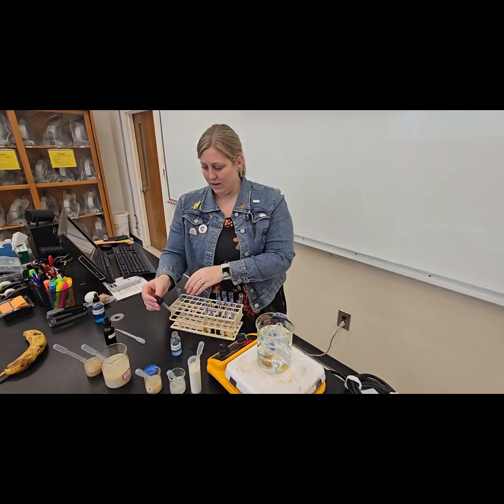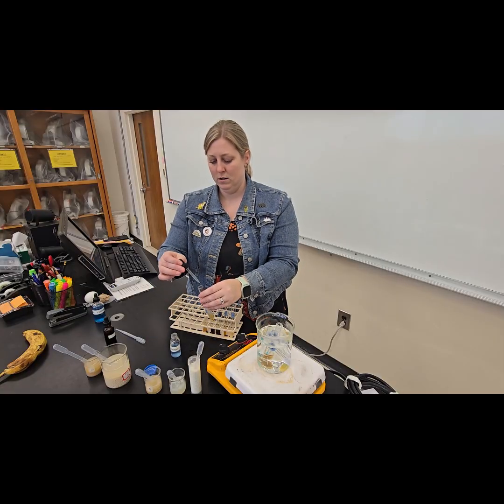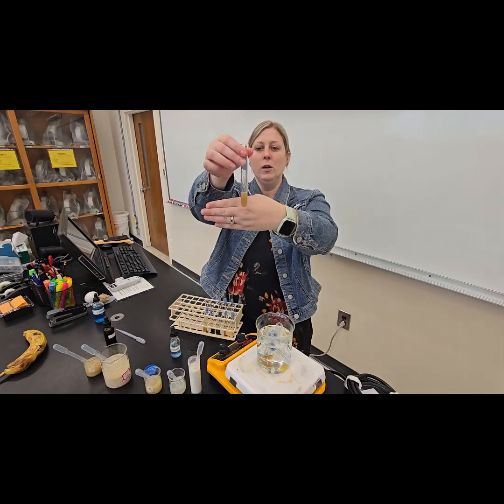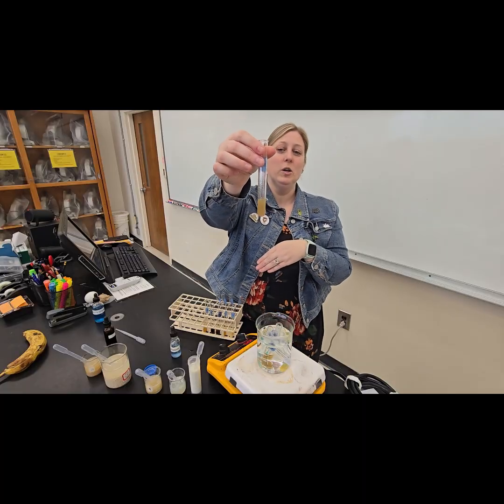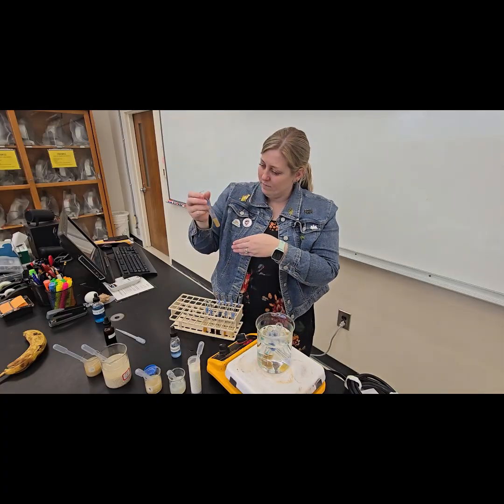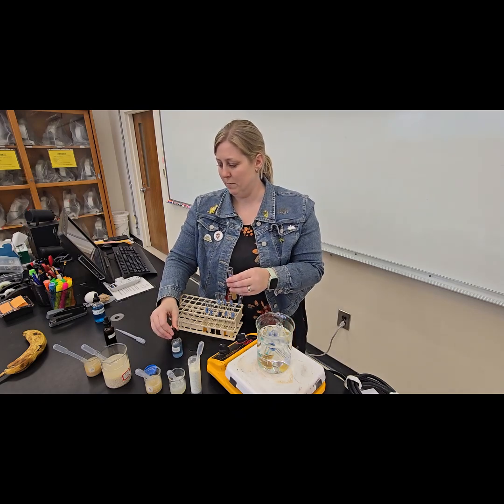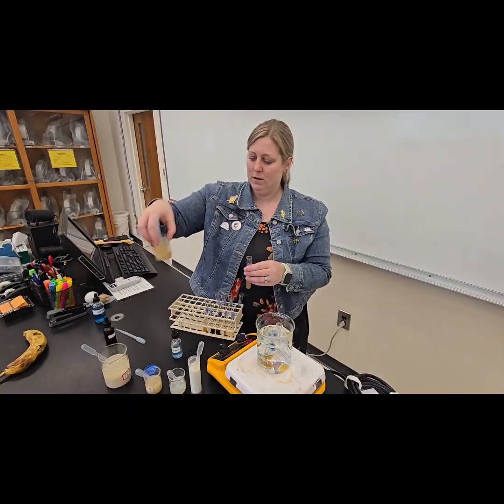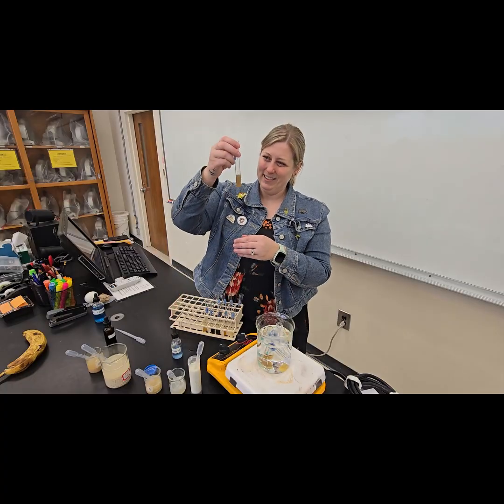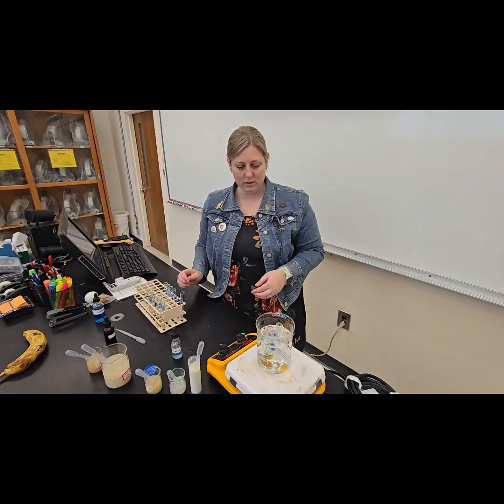Okay. And then last but not least, our unknown. Let's see what we get with the unknown. Now, sometimes we have to remember when we're testing foods, we have some colors involved in those foods, which may or may not affect our results. I'm not seeing a lot of color there, so that looks like it's just the same color as, again, our unknown is kind of this brownish yellow color. Put a little more in there. Nope, it looks like it's staying the same. So do that what you will with your results.